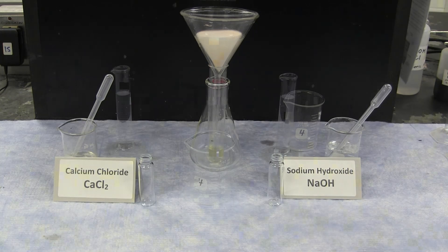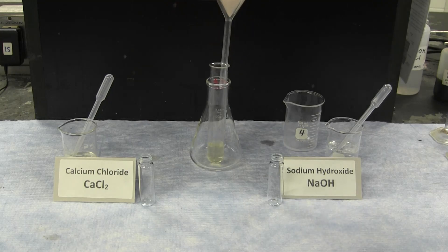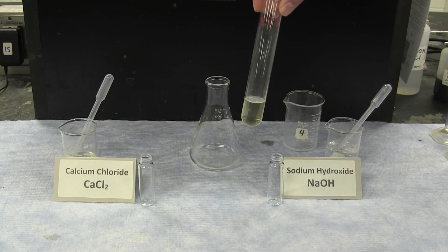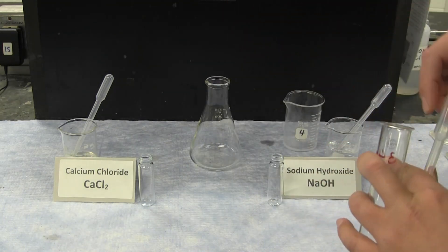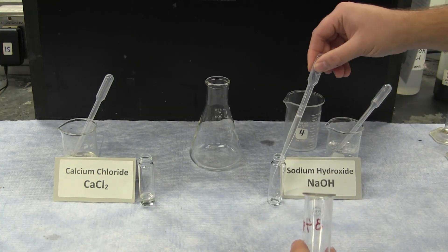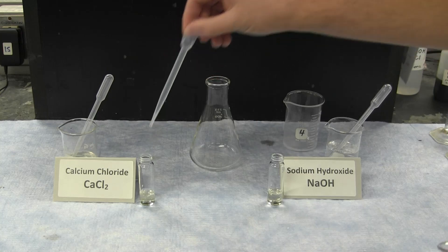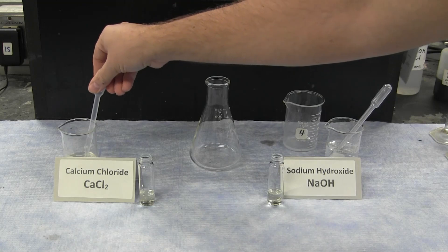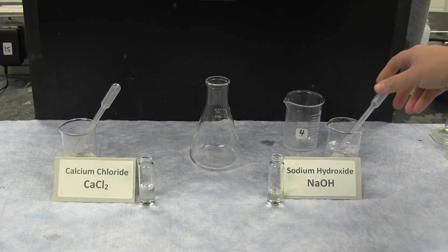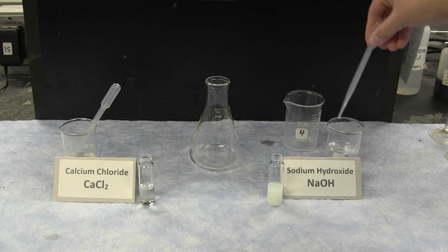After some time, when enough filtrate is collected to perform the secondary experiments, we can remove the filter paper and look directly at the experiments with the filtrate containing only unreacted initial ions. To some of the filtrate, additional calcium chloride is added, and there is no reaction. To another portion of the filtrate, additional sodium hydroxide is added, and additional precipitate is formed.